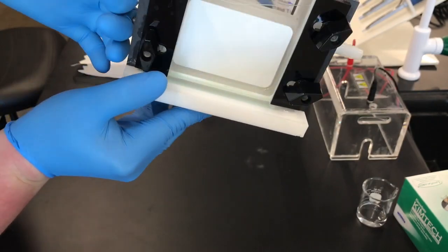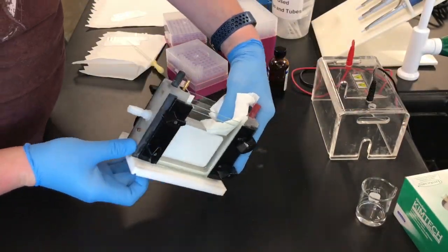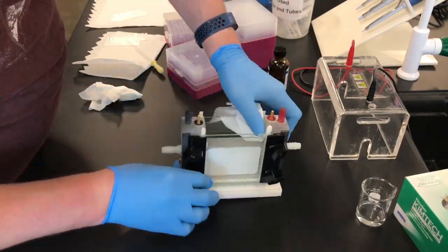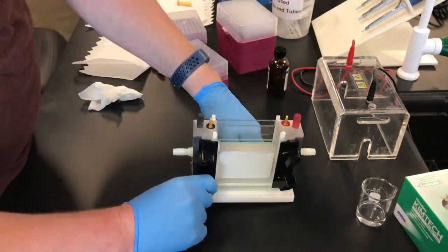After about 15 minutes, the gel should be completely solidified. You can confirm this by tipping it to see that it is not moving. Using a chem wipe, wick away any additional water that remains in the gels.